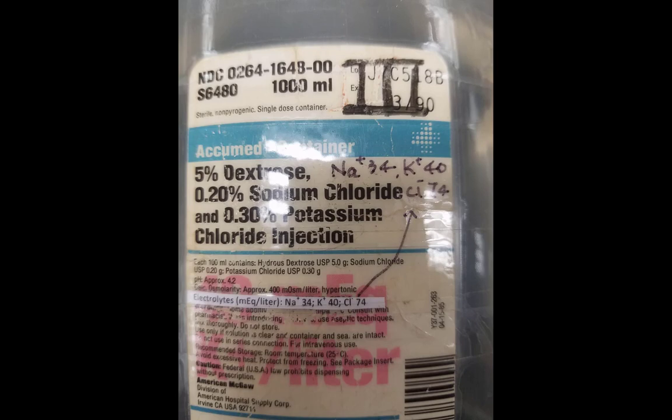And here is IV bag three. IV bag three also contains three different types of ions, sodium, potassium, and chloride. Pause if needed. And that will be the end of this video.